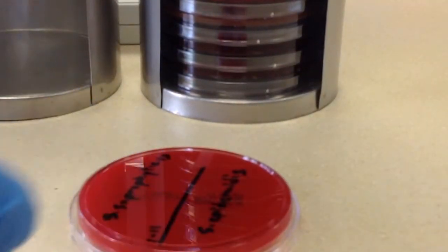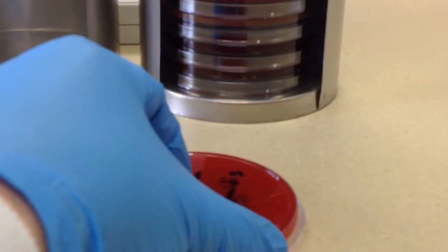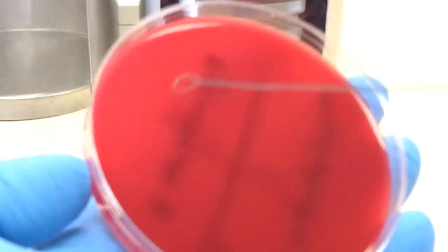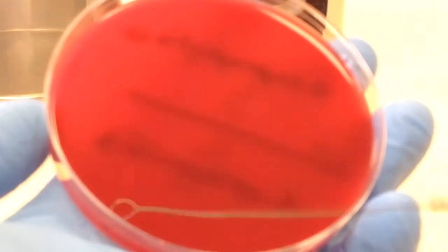Now I'll go ahead and repeat this with the staphylococcus epidermidis. So you just want to make sure that you don't get close to the other organism on the other side of the plate.